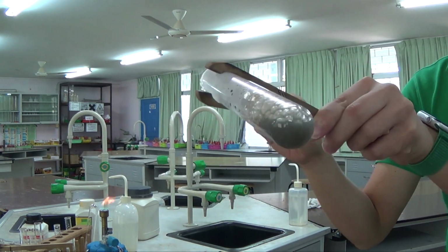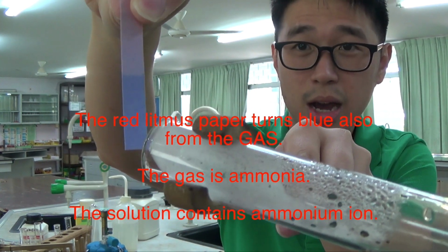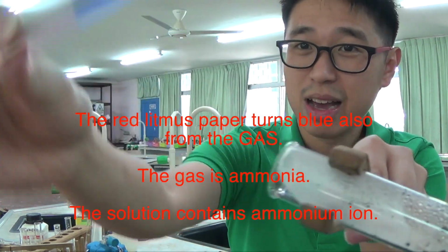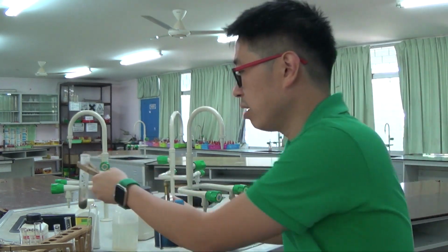Okay, so that's kind of boiling, and then this is my red litmus paper. As you can see, I'm not touching the inside. I'm testing the gas. I'm not testing the solution on the inside. This is a red litmus paper turning blue. So it's a moist red litmus paper turning blue.